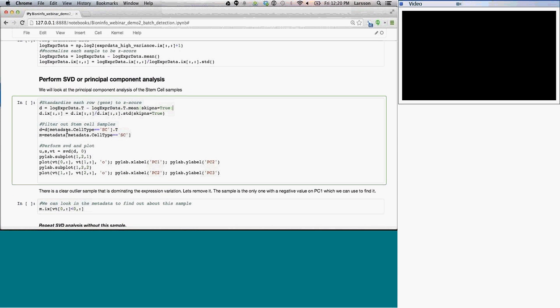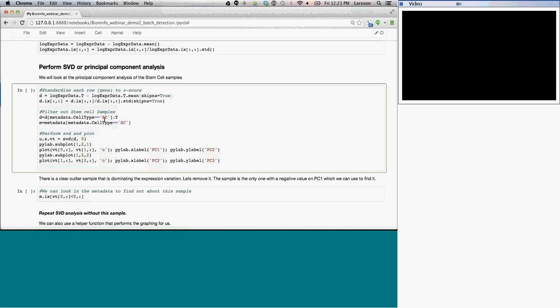So I did that by column, which is standardizing each of the experiments, and then I'm going to do the same thing by standardizing across each of the genes as well. And then after that, I'm going to extract only those samples that are stem cell. So I'm going to ignore all of the differentiated states. Again, we can repeat this analysis without doing this filtering first, and we'll be looking at all the different states, so mesoderm, endoderm, ectoderm, embryoid body, and stem cell. But we're going to look at the stem cell so we can see more of the variation that's associated with one state, because most variation otherwise will capture the differences between the different states.